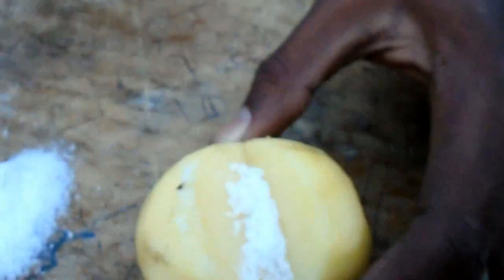The last procedure is to leave it for a while — maybe three minutes, five minutes — to observe what will happen. So let us wait a little bit of time so that you can see what is going to happen with these Irish potatoes.